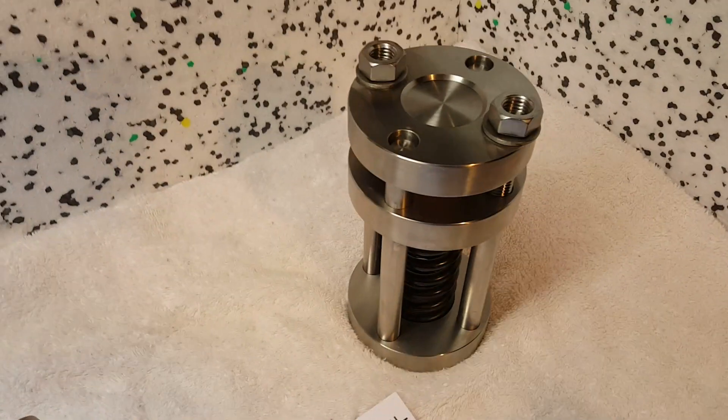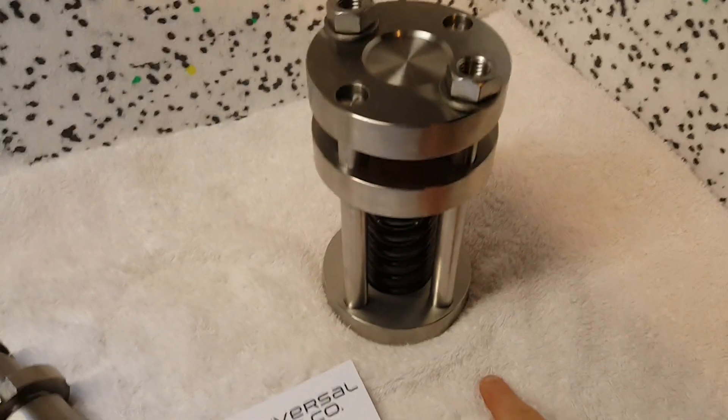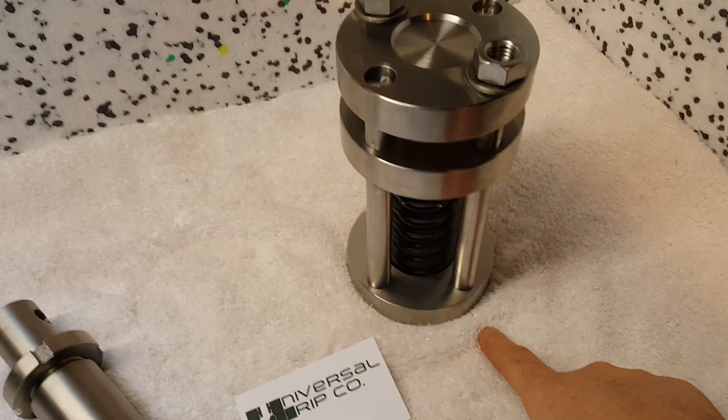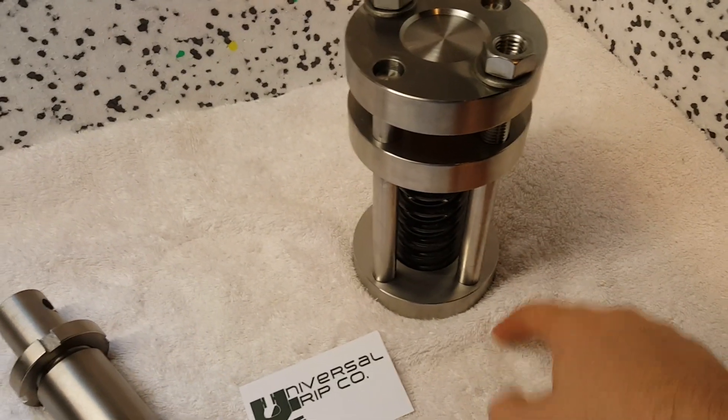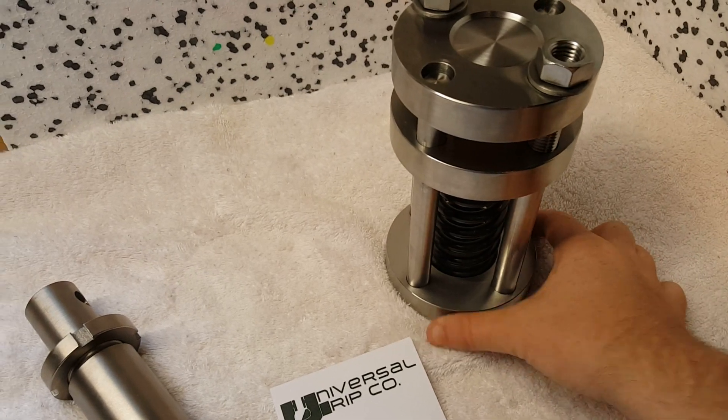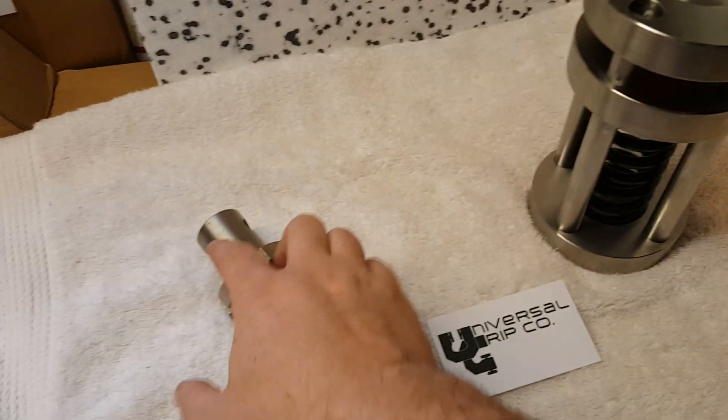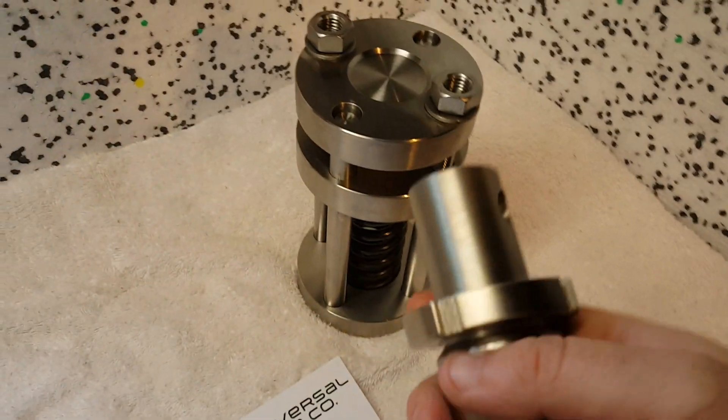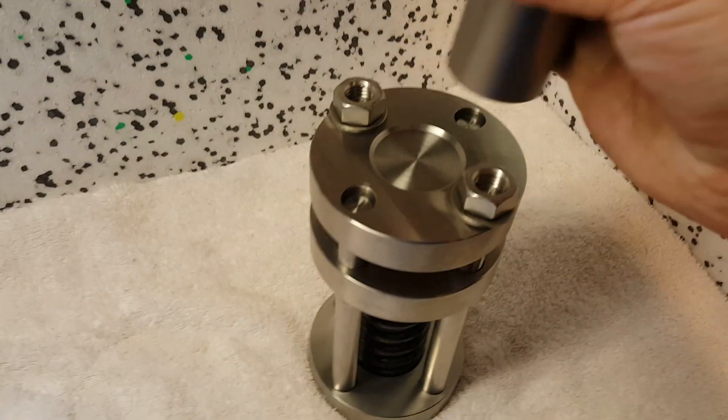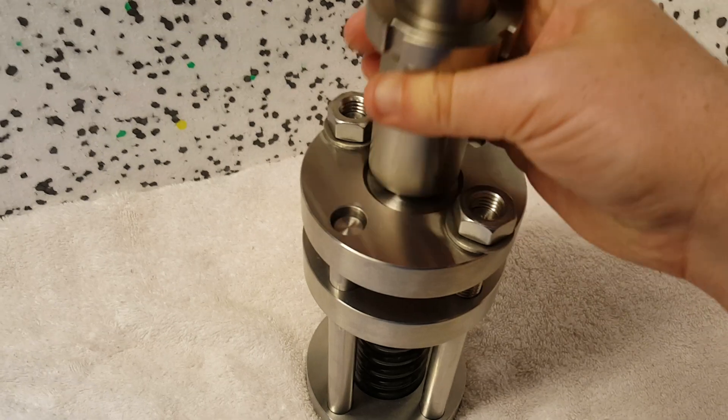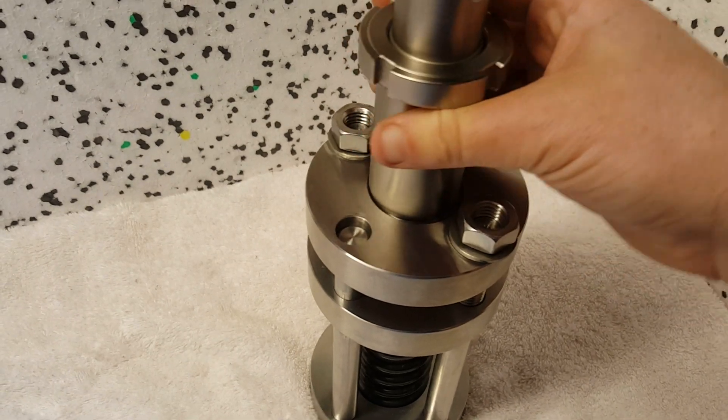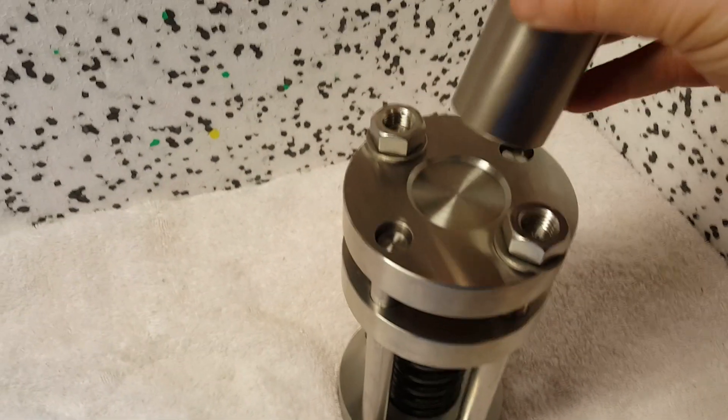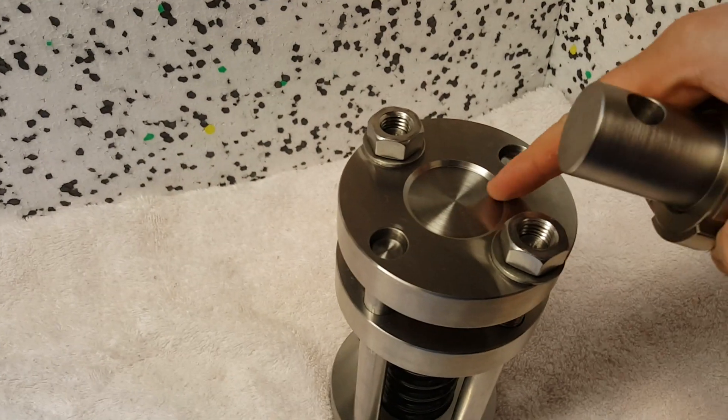We would go ahead and put this on the universal testing machine. I'd recommend a compression platen on the bottom to hold this flat plate. This top here is a compression plunger and it goes right into this little ridge, resting just inside there.